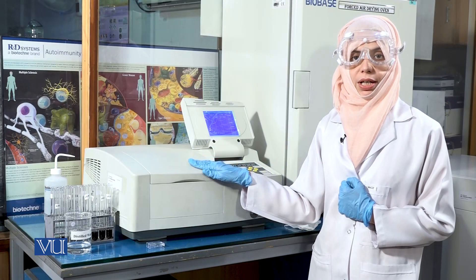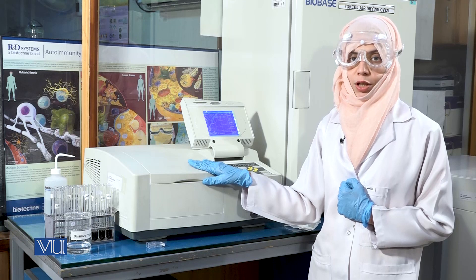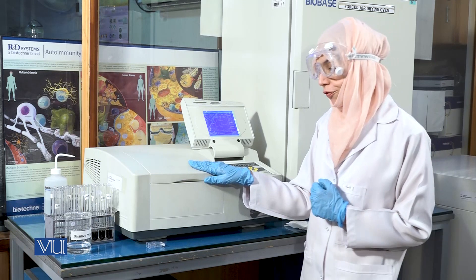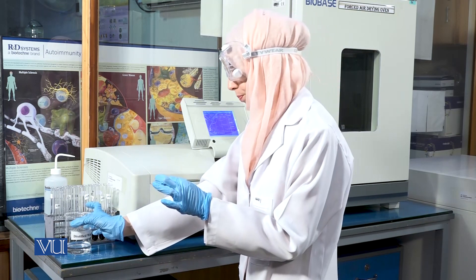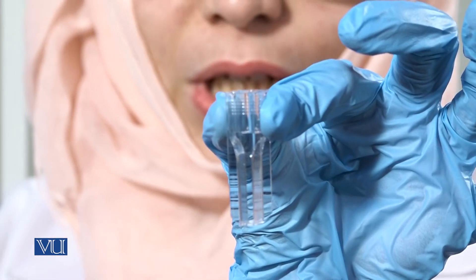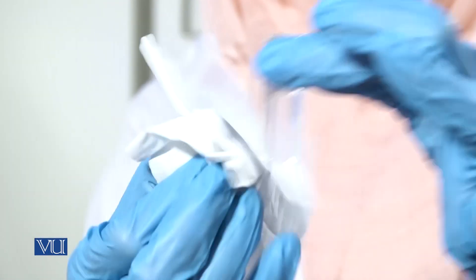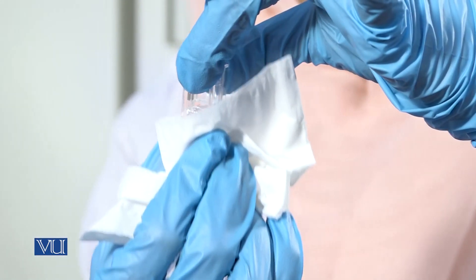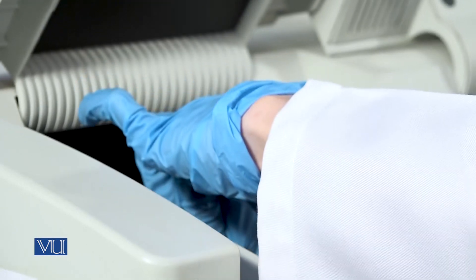We will proceed to the spectrophotometric analysis, whereby we will measure the absorbance of each solution at 620 nanometers. To begin with, we will first need to use distilled water as a control and set the point value as 0. Fill the cuvet carefully with distilled water. Ensure that you do not touch the sides of the cuvet through which the light beam has to pass in the spectrophotometer. Wipe the sides of the cuvet using a clean tissue paper and place the cuvet in position in the spectrophotometer.